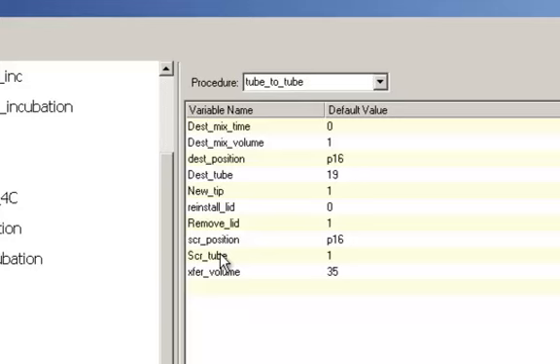One other thing, I mentioned that in the add reagents, if you switch from the cold block to a PCR plate or some other type of plate to keep your master mix reagents, you have to switch that over there in that procedure. Okay, if you switch to a different type of labware for your master mix, this tube to tube procedure will have to be edited also, or you can just make the master mixes by hand and add them to the plate. Once you understand how this method works, hopefully you'll know where to change those things if you need to change those for your application.